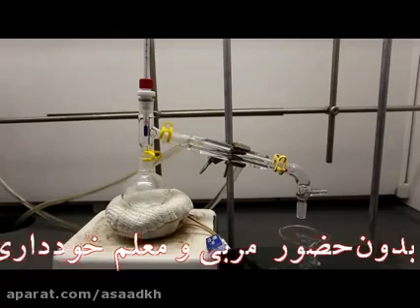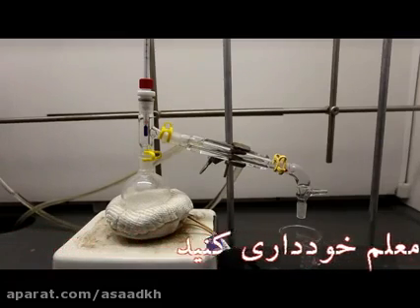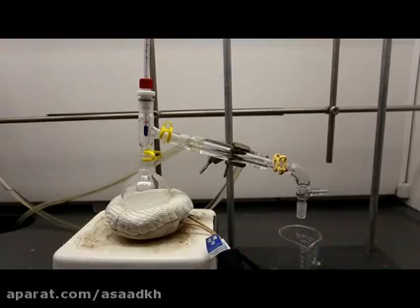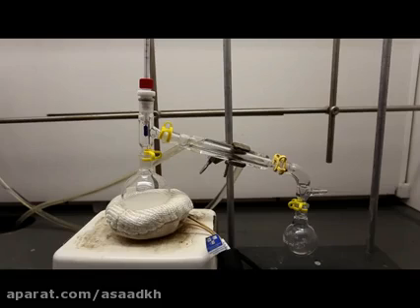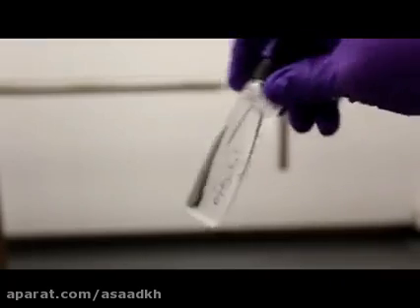A distillation apparatus is then set up. Pentyl acetate boils at 149 C, so everything that came over below this temperature was collected in the beaker and discarded. There might be a little bit of water that comes over with the product. If you are worried about any water in your product, you should dry it before the distillation with something like magnesium sulfate. The final product was then poured from the collecting flask into a dram vial.